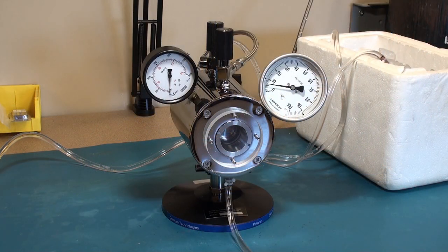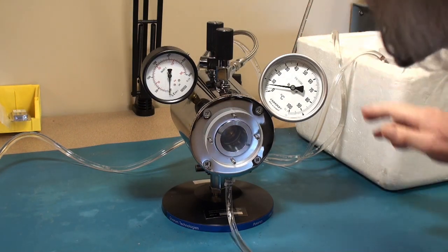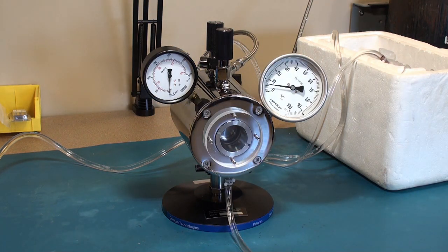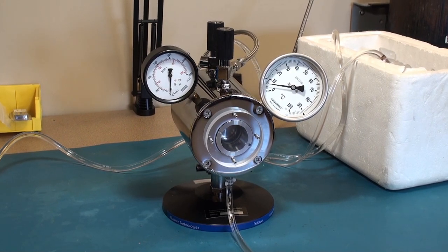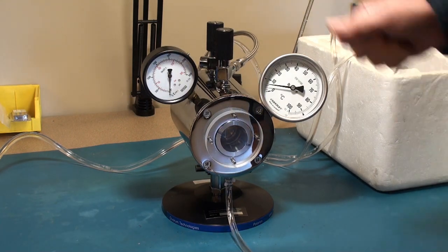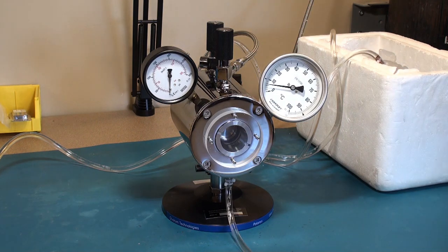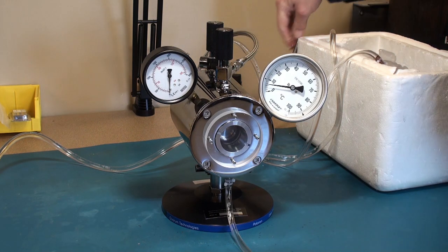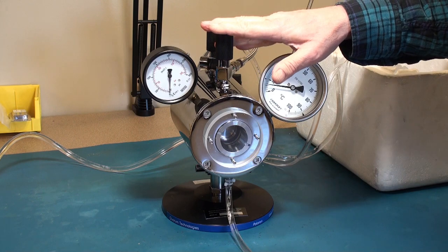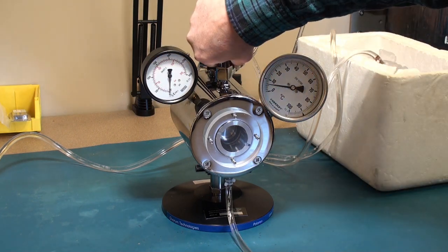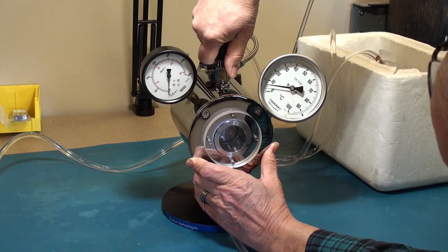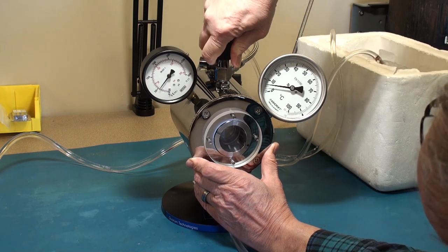Okay about 25 minutes has gone by and I'm at 6 degrees, which I consider close enough for demonstration purposes. So while cooling the chamber, I am going to open the tank valve supplying liquid CO2 down the transfer line up to this valve that it's attached to. I am going to open that valve.